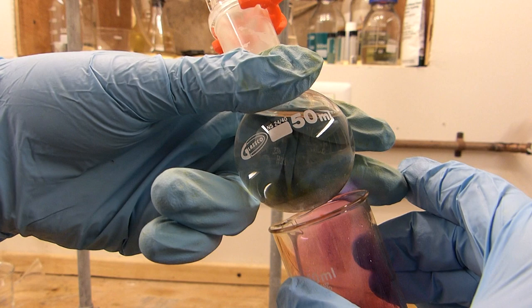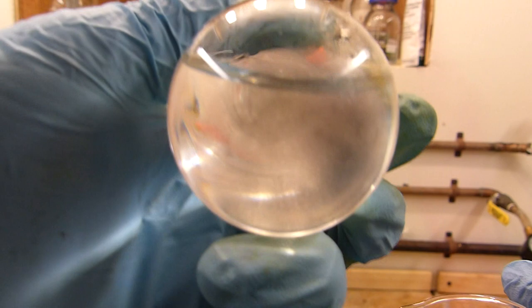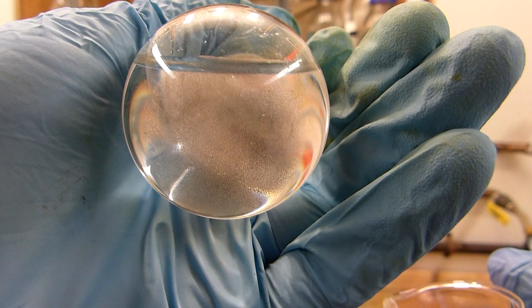And you can see the shiny crystals maybe on the side of the flask. Let's see what we've got. It's probably pretty hot. Well, you can see the crystals deposited on the bottom of this flask. The camera will focus on them.